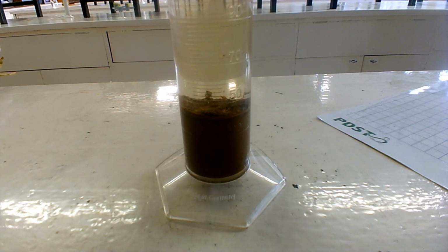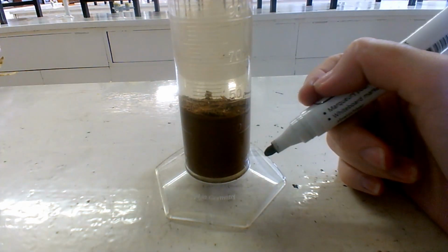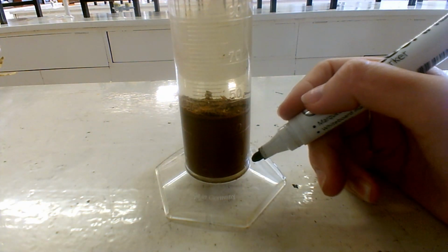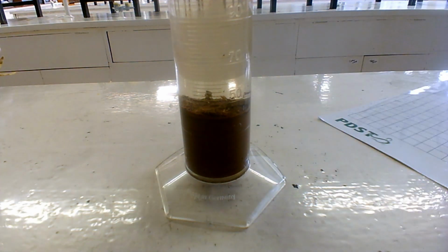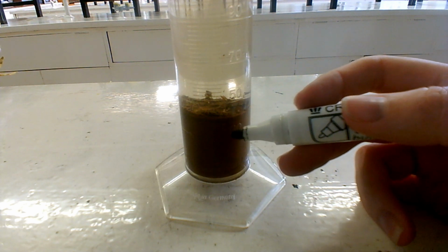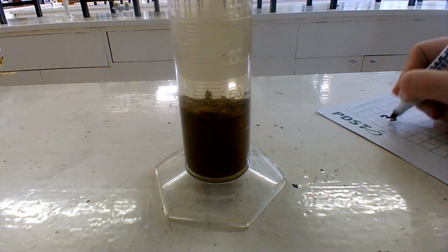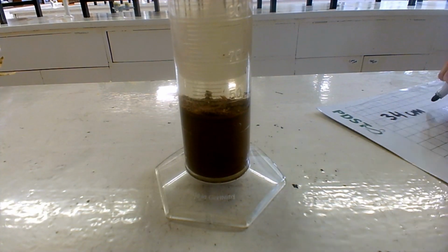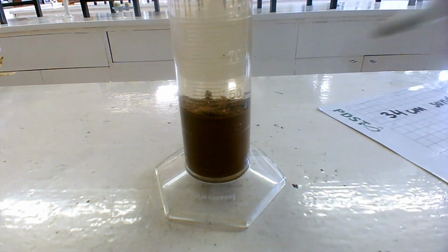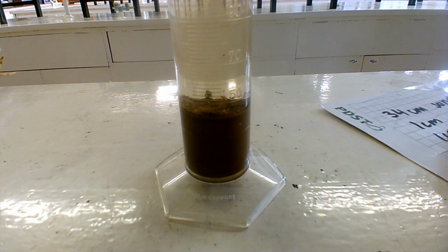This has been left to settle overnight, and like you can see here, all of the layers have settled down to the bottom of the container in water, and we have the heavier or more dense particles at the bottom, which would be sand, followed by silt on top, and then clay. So what you then do is read these graduation marks. Mine starts at 30 here, and I have 31, 2, 3, 4, 34 centimetres of sand. I have 1 centimetre of silt, and I have 1 centimetre of clay.